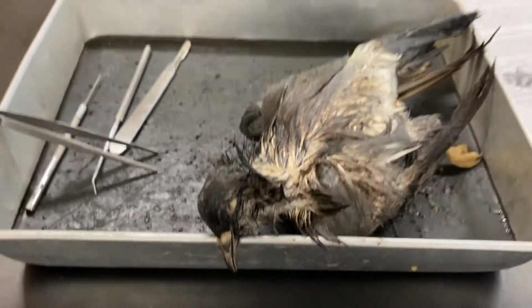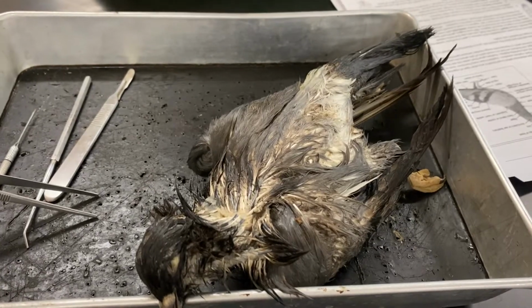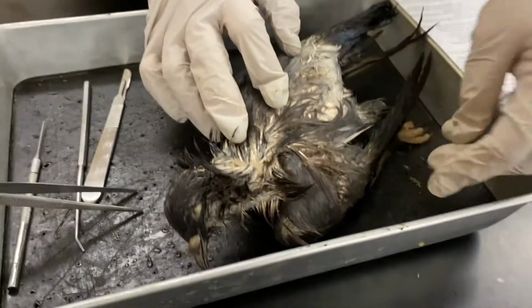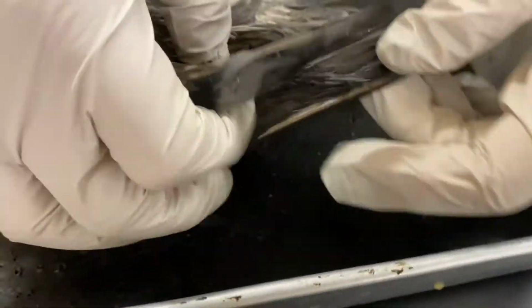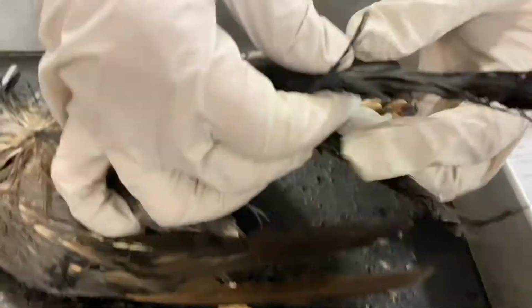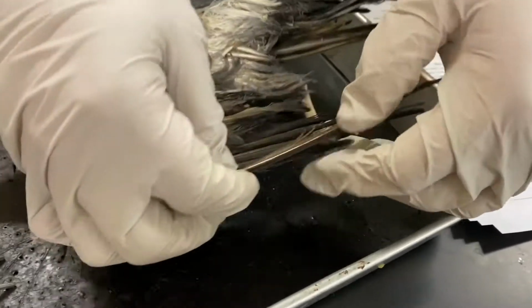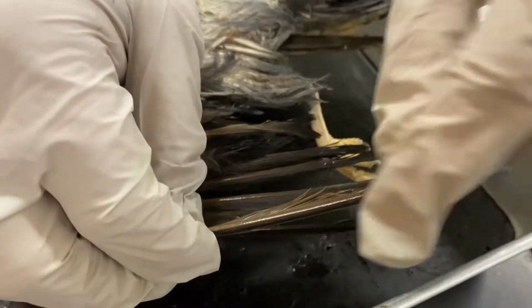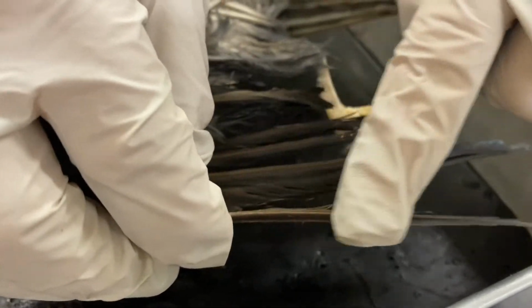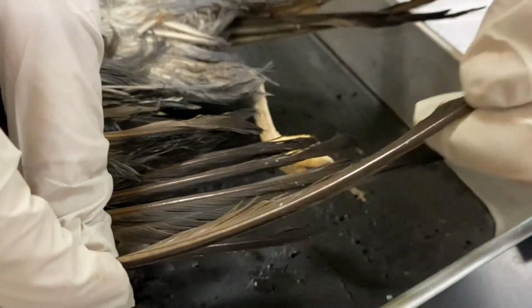Of course, one of the most noteworthy features of a bird is the feathers. The feathers are made of keratin, and they are adapted scales. And we can see different kinds of feathers. So we have the flight feathers on the wing as well as on the tail. They're the really long ones. And if you feel the flight feathers, you probably can't feel it, but if you see, there is this spine or ridge here, and that is the leading end that would cut the air.